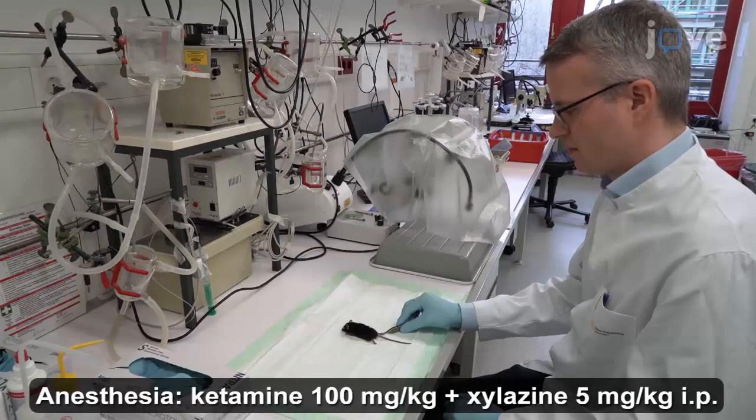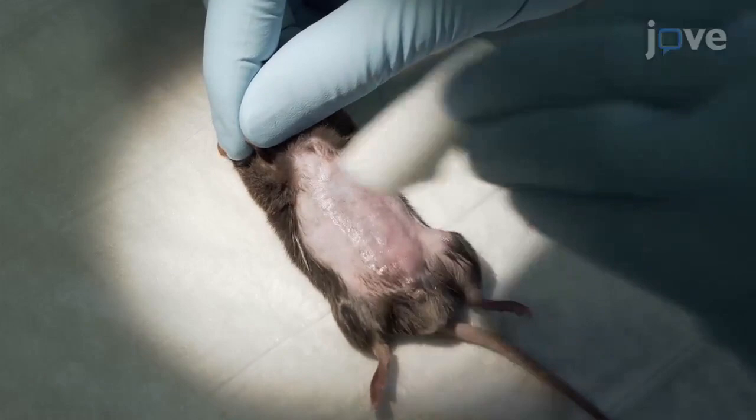Begin by confirming a lack of response to toe pinch and disinfecting the ventral side of the anesthetized mouse with 70% isopropanol.